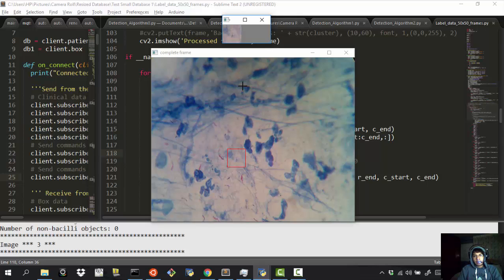Okay, so the point is that we move through the image using the commands that I have set with the keyboard. It's very easy to do. For example, I want to classify this little frame as a tuberculosis bacteria. Suppose that I decide not to use 50 times 50 frames and use 25 times 25 frames. Remember that I want to treat this as an OCR program. So we just position ourselves right over here, and you can see that the small chunk of the image is present.